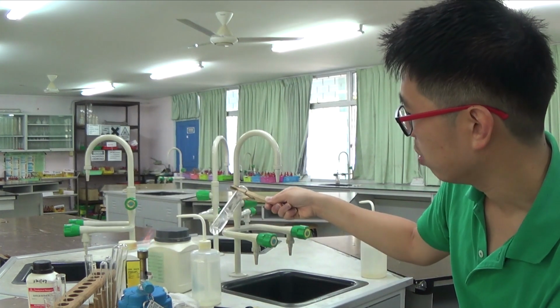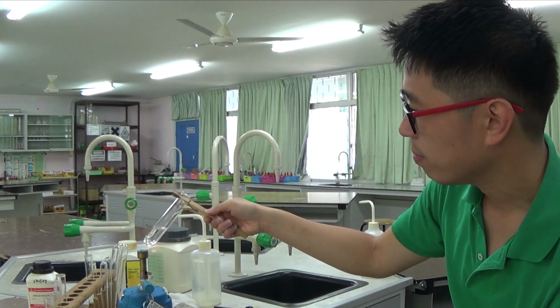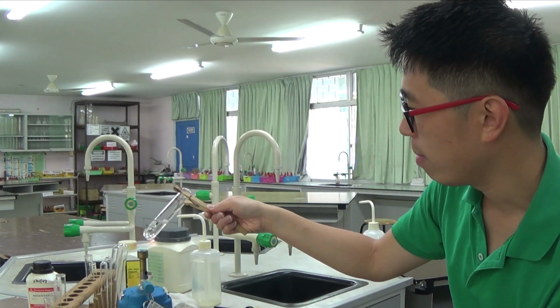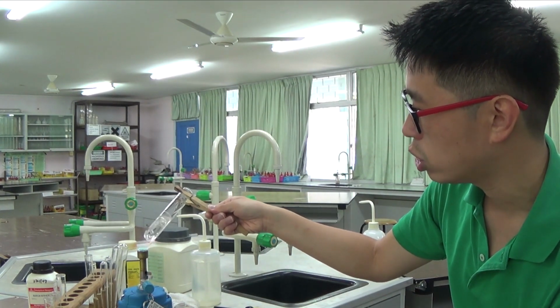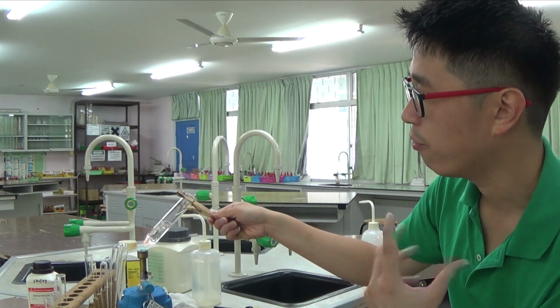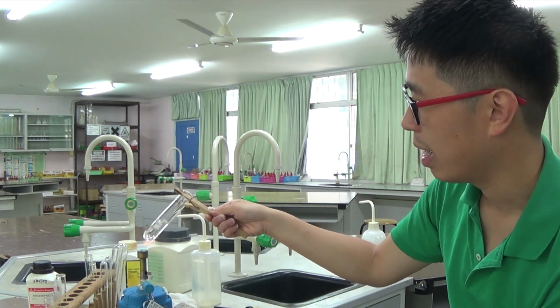So I must keep on doing this until all the ammonium has undergone the reaction. Then the nitrate anion would have remained in solution. If the nitrate ion remains in solution, then I could test for the nitrate, and any ammonia that I get afterwards would have come from the nitrate ion reacting with the aluminium itself.